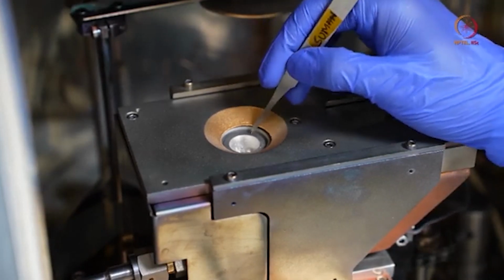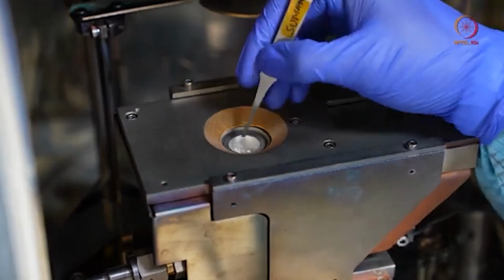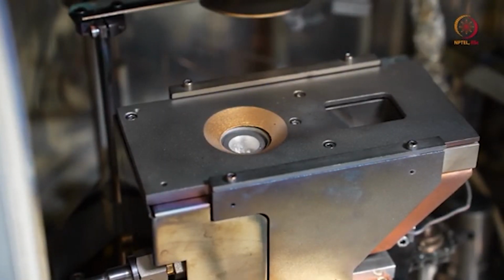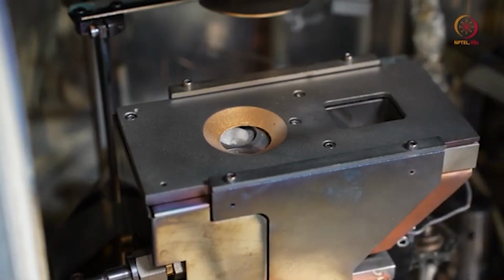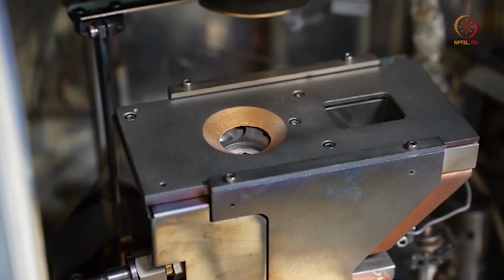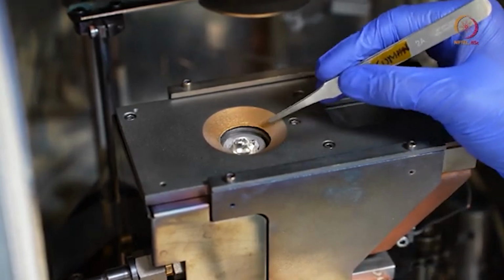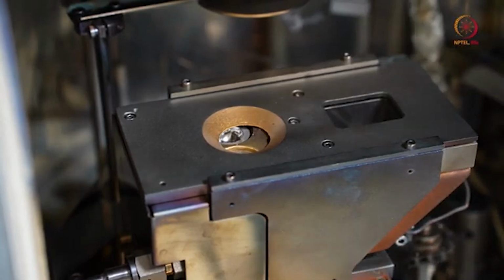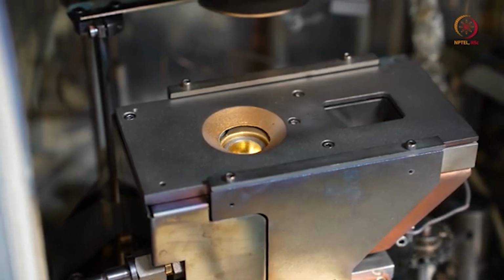So we need to deposit this, and we have already shown that titanium is also there, and the amount of material we want to deposit is also okay. So we can now go for the deposition. That is our first thing. As we will be depositing titanium first, you should make sure that titanium will be there first, and then the gold, and we will change during the process.